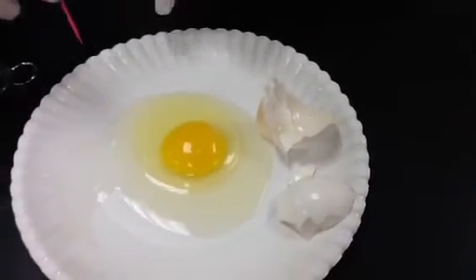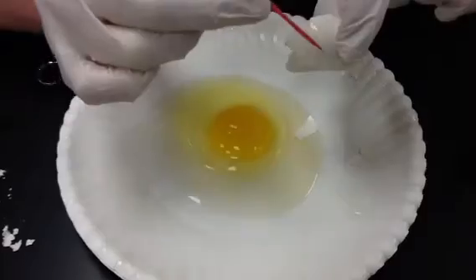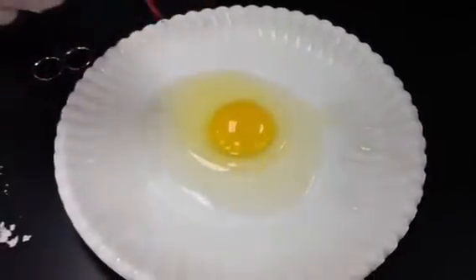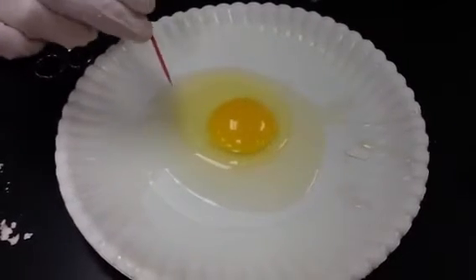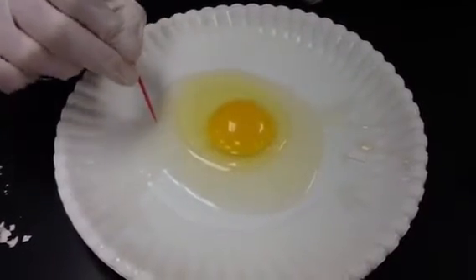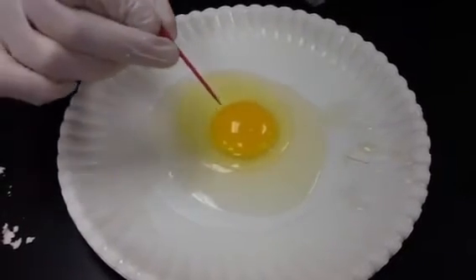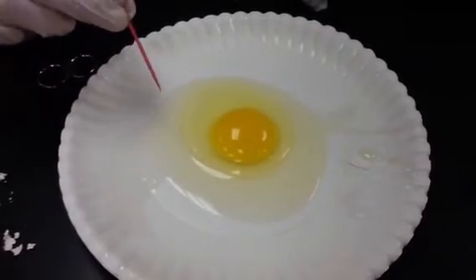So then the rest of the time we're going to look at the actual pieces of the egg here. Obviously we have the shell, we have the part you just named with your partner, and we have the other pieces. With your partners, you're going to have to identify these parts and also their functions further down underneath the questions of the lab, and also label them in the pictures that were given to you. What I just want to do is go through them with you real quick.